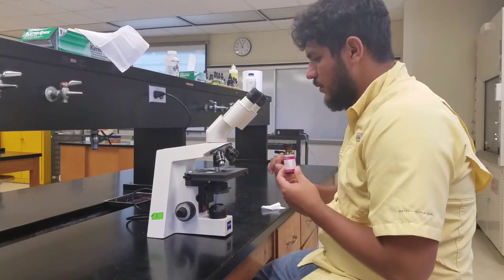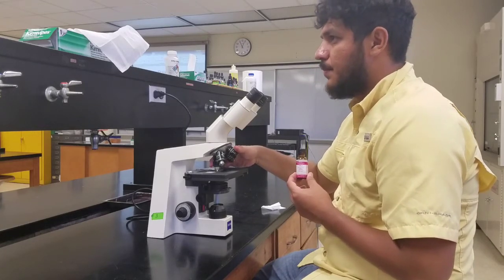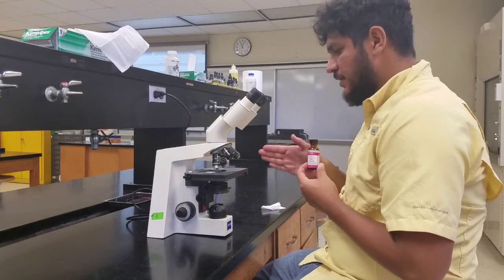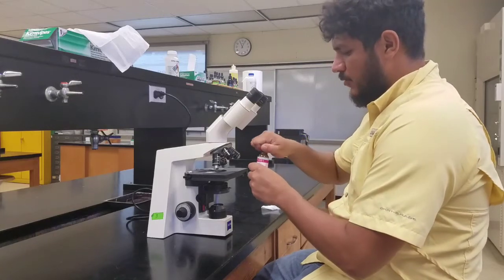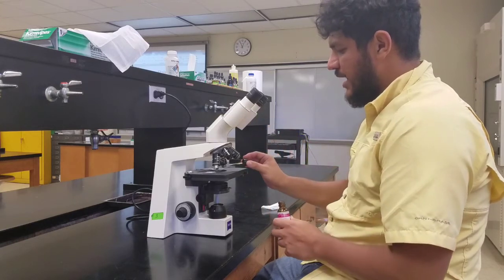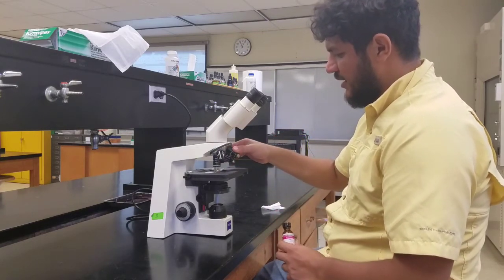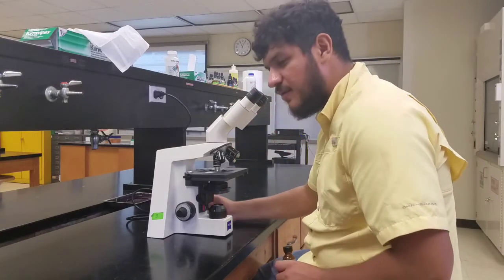So what we are going to do is grab our lenses again and rotate our revolver halfway to where my oil immersion lens is. Once I do that, I'll have a gap in between the 40x and the 100x. I will grab my oil immersion and put a drop of oil onto my microscope slide, pop my oil immersion lens in place, and again, this is an even smaller working distance than before.